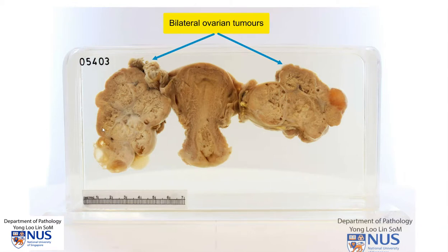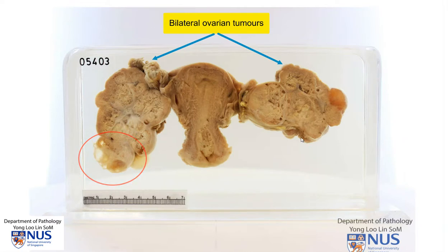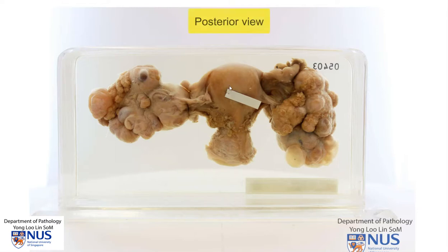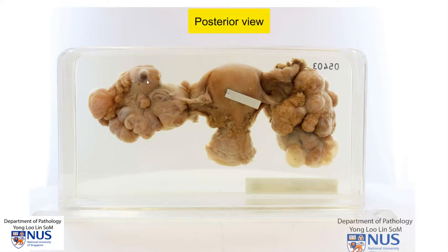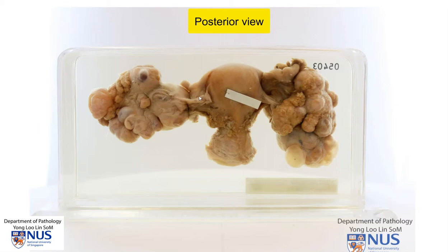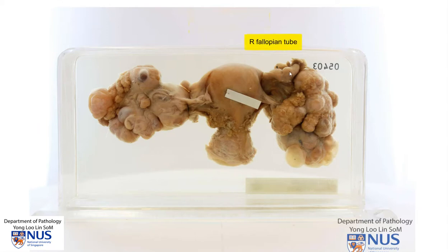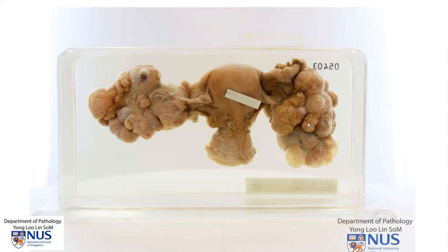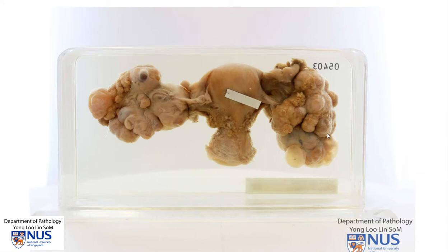These tumors are predominantly solid with some cystic areas and I'm going to turn this specimen around. Here is the posterior serosal surface of the uterus, and this is the left ovary which is very much enlarged. We can't really see very much of the left fallopian tube, and here is the right fallopian tube with the fimbrial end, and this is the right ovary which is very enlarged and has a somewhat nodular appearance.